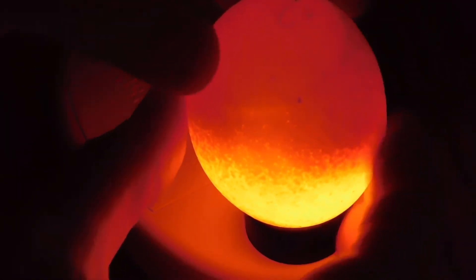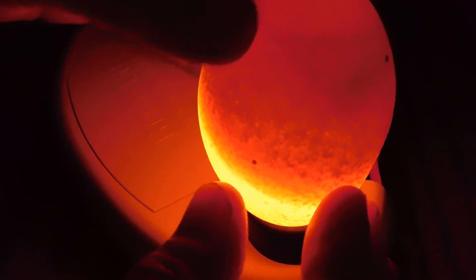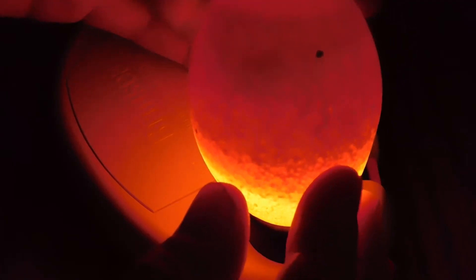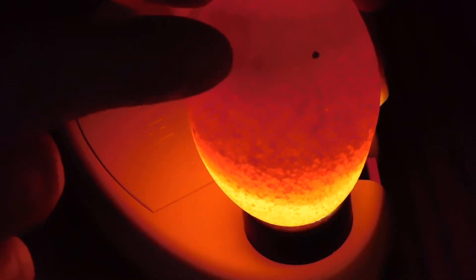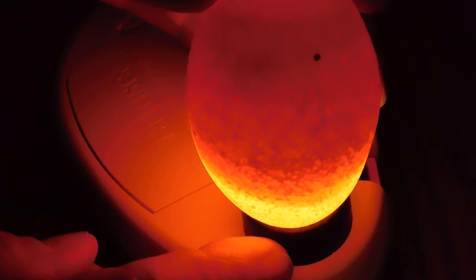On to number three. It doesn't look like that first egg we handled. Pay no attention to that little black spot right there - that's just a spot on the egg. But you see here we do have an embryo in there. He's just not very close to the edge for us, and he's a little lazier than the others, but he's definitely in there.